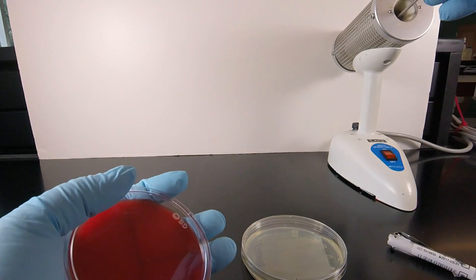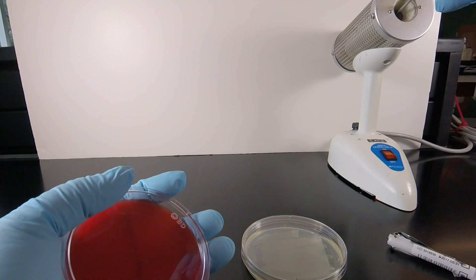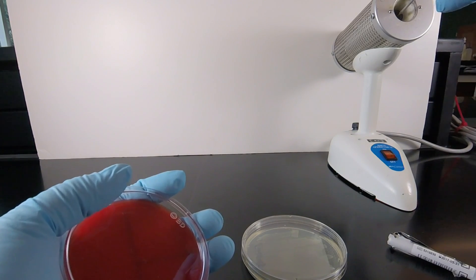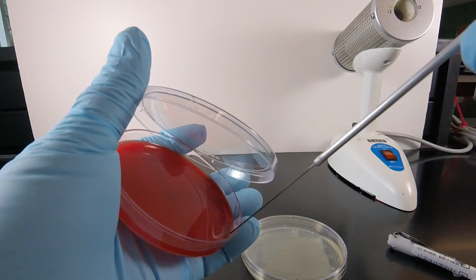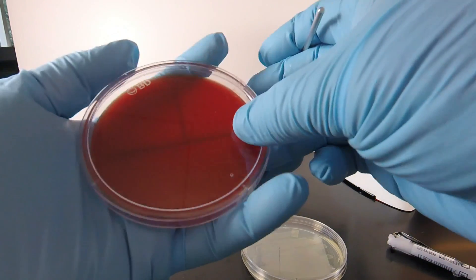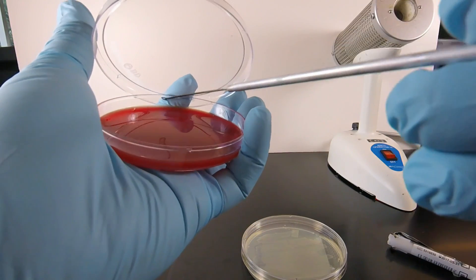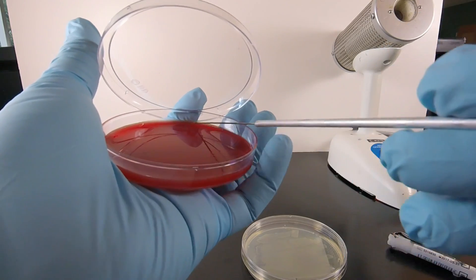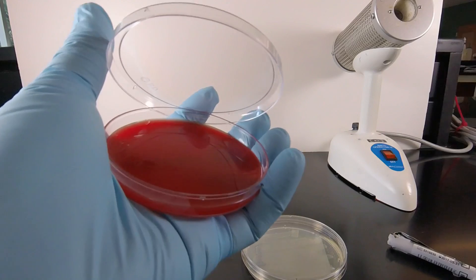Then again we sterilize the inoculating loop and stick it in the agar to cool at the very edge. We rotate the plate so the bacteria in Sector 2 are now sitting at 9 o'clock. We take our sterile inoculating loop, drag that through Sector 2 a couple of times, and spread that out over Sector 3, being careful not to touch Sector 1.